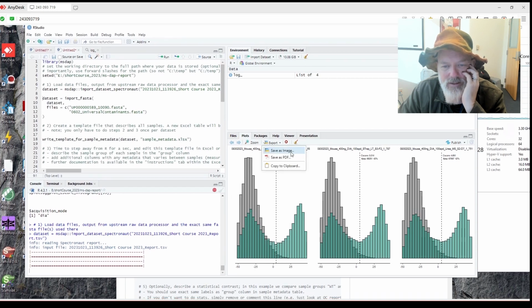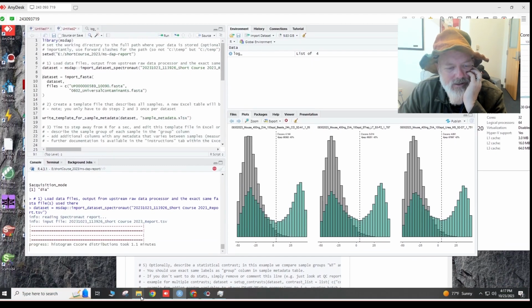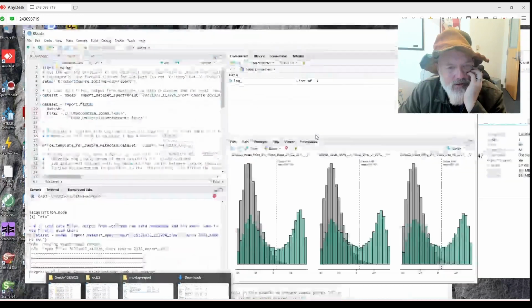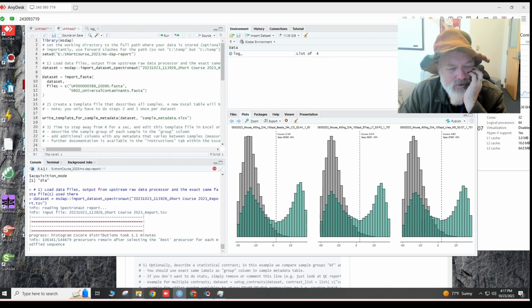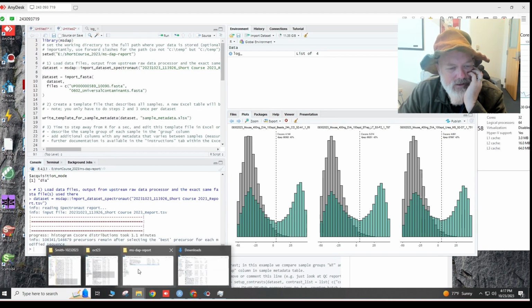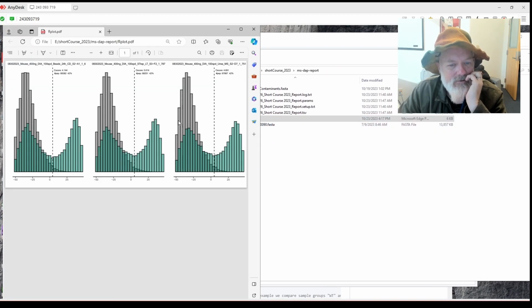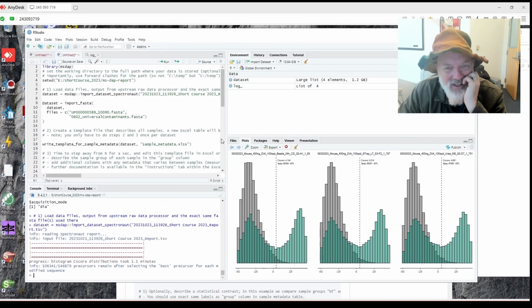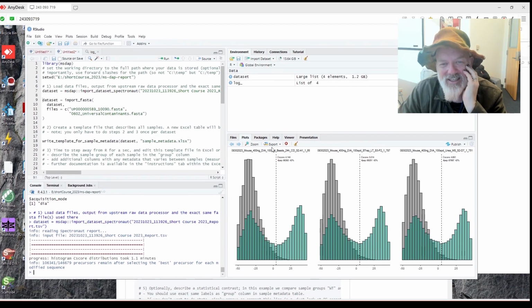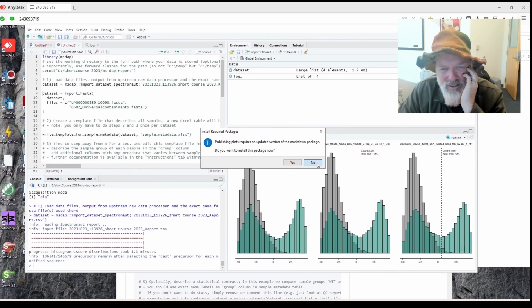Can you save this? Save as PDF, I guess. Okay, let's see if that saves it. Took 1 minute. MS DAP report. Oh, look, there's a little PDF. Did that work? That only did 1 at a time. That's annoying, like 1 screen at a time. There must be a better one, huh? All right, so it looks like now we have a data set. I wonder if we could export all of them. I don't know. There must be a way to do it, huh? Publish. Oh, gosh. I don't want to do that.